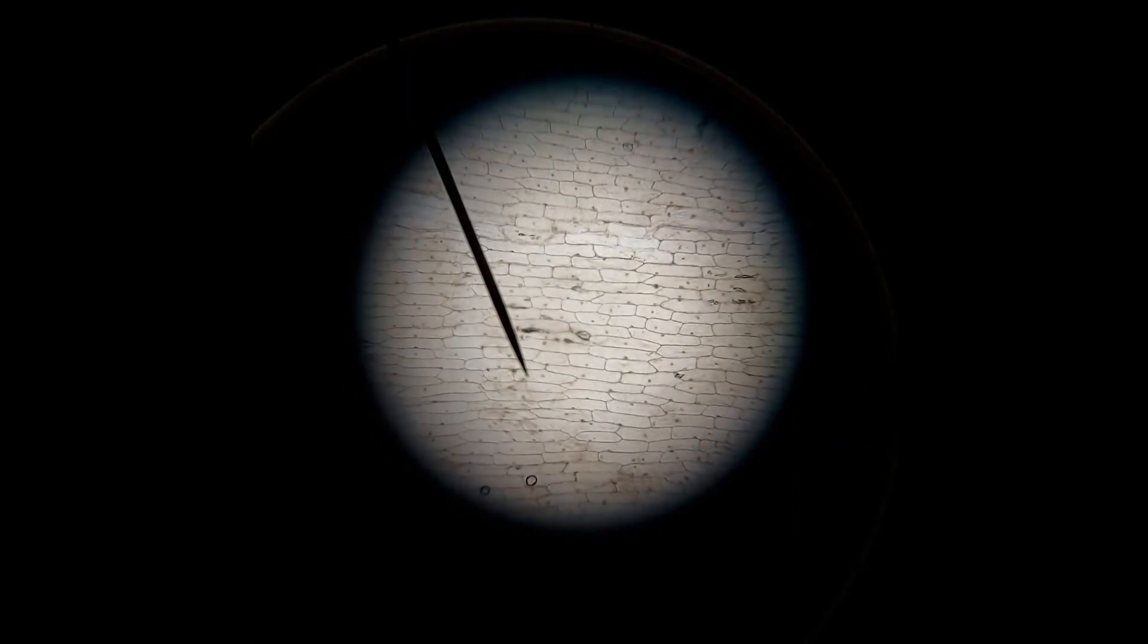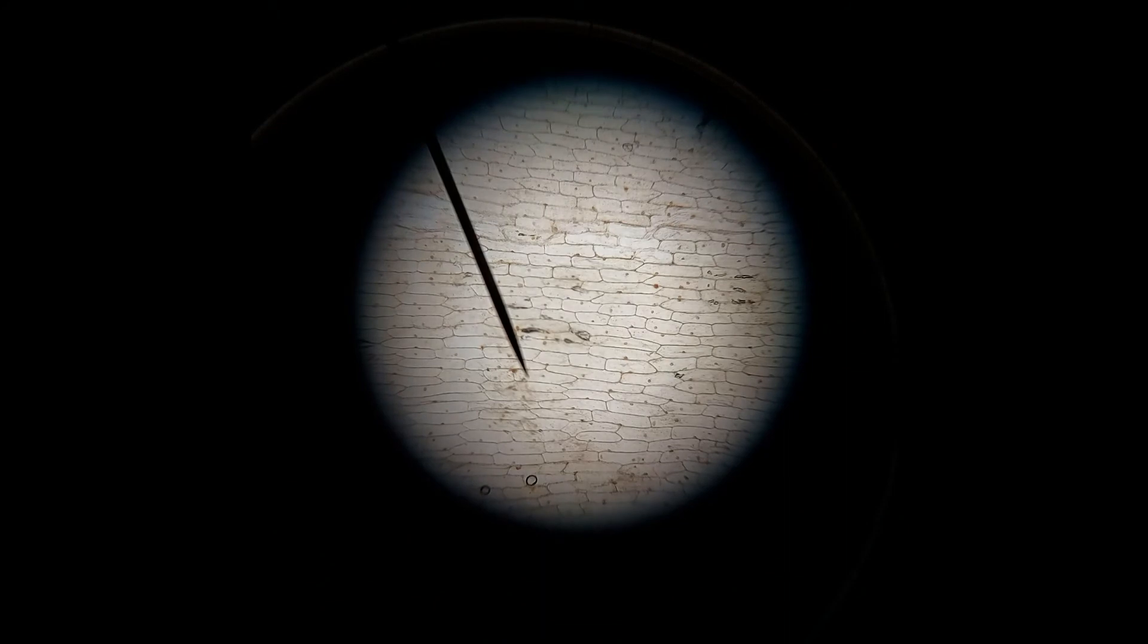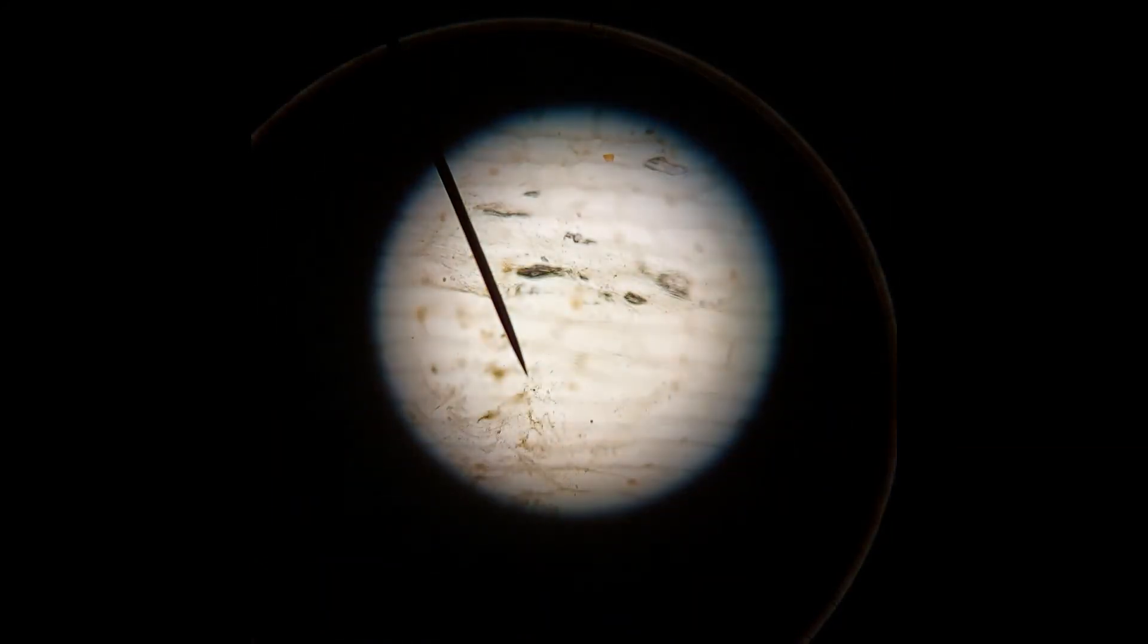So I will now adjust it to make me find the cells very clearly. As you can see, a large field of view. Plenty of cells. I don't want to draw that many cells. So I'm just going to zoom in. So that's now 100 times magnified.